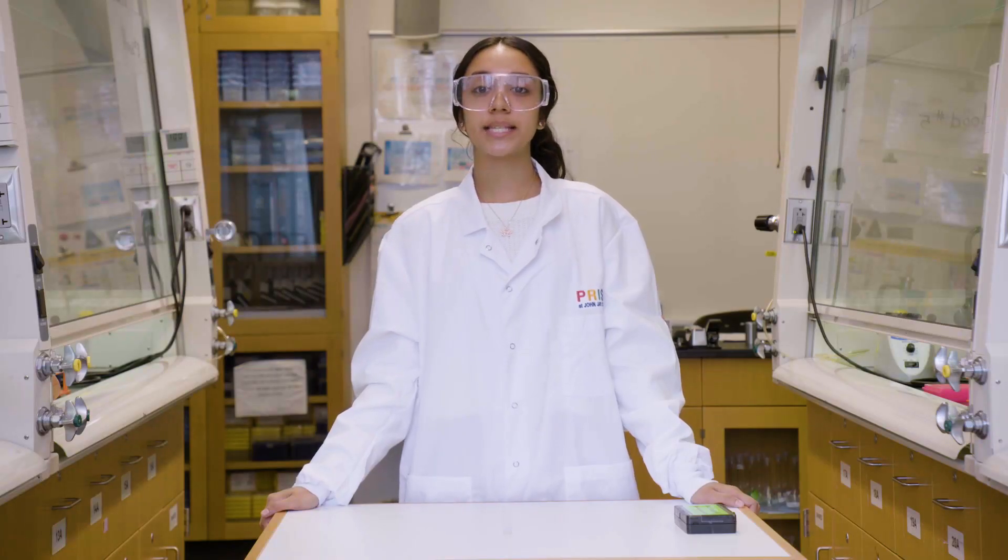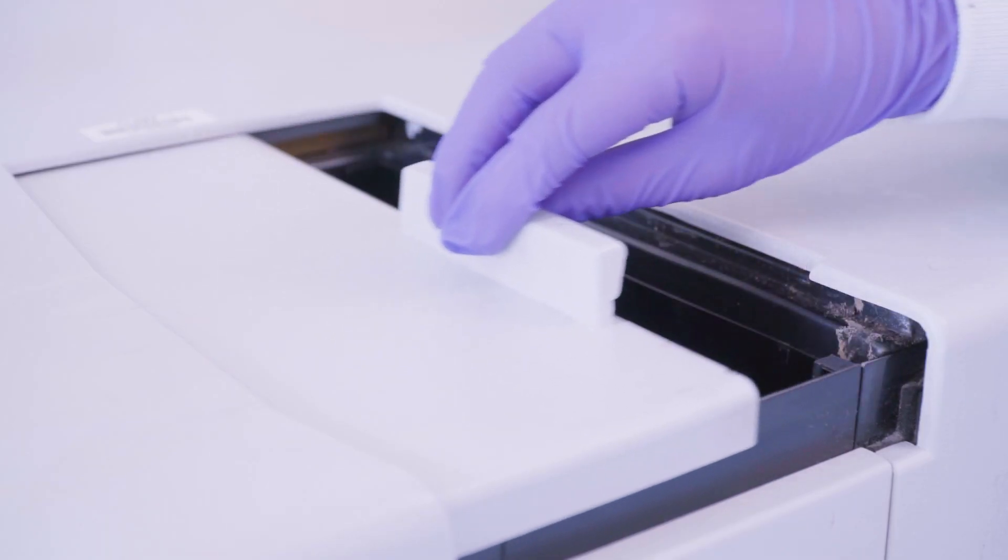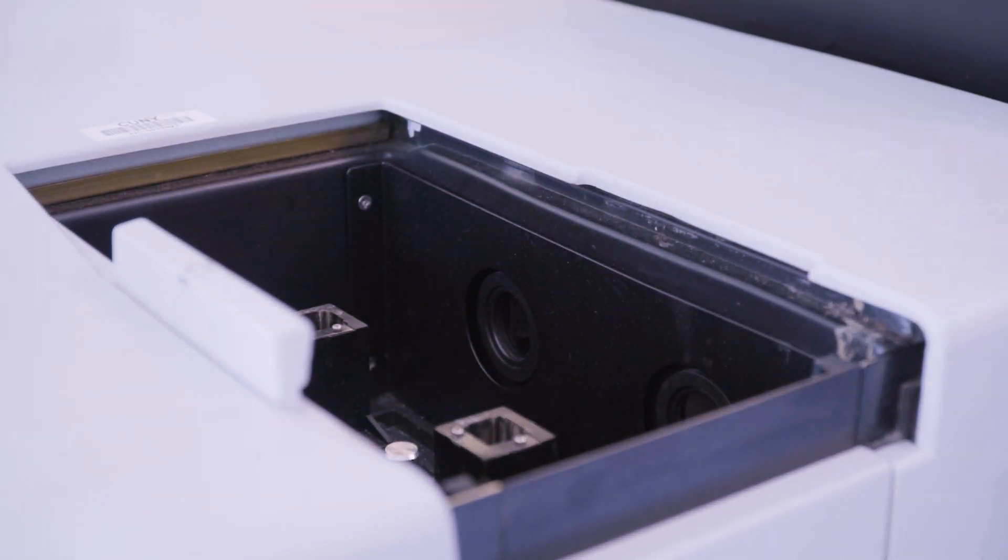Next, insert the cuvette into the sample holder. Ensure that the clear side of the cuvette faces the light beam.